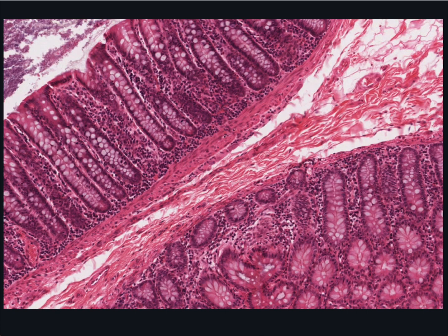If we now focus on the mucosa, note that the villi, characteristic of the small intestine, are gone, but the glands, still called crypts of Lieberkühn, remain. In a section exactly perpendicular to the surface, the glands might look like boundaries between closely packed villi.